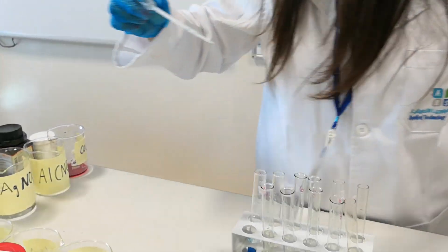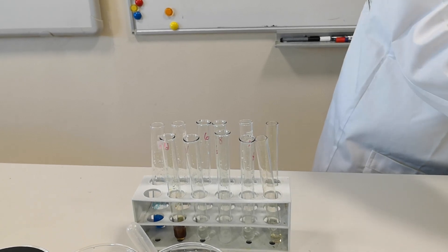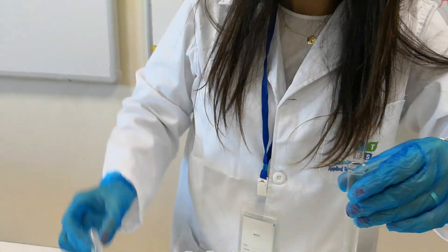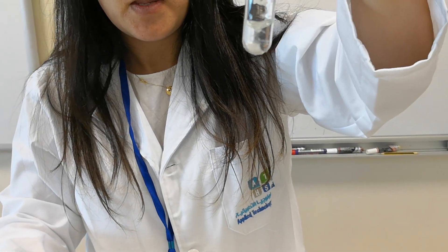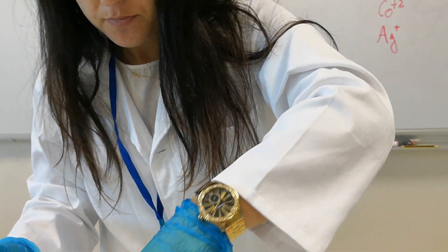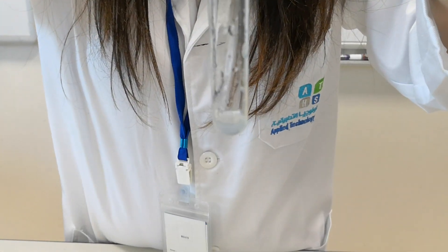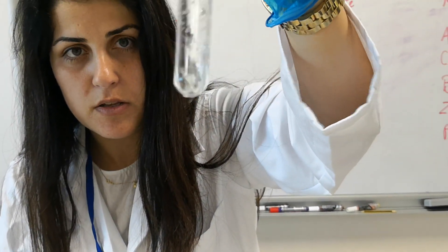Now the zinc. This is a solution of zinc. Adding sodium hydroxide — it forms a white precipitate, but with excess sodium hydroxide this white precipitate redissolves. Let me repeat this slowly: adding a few drops of sodium hydroxide gives a white precipitate, and if I add more, it will redissolve.